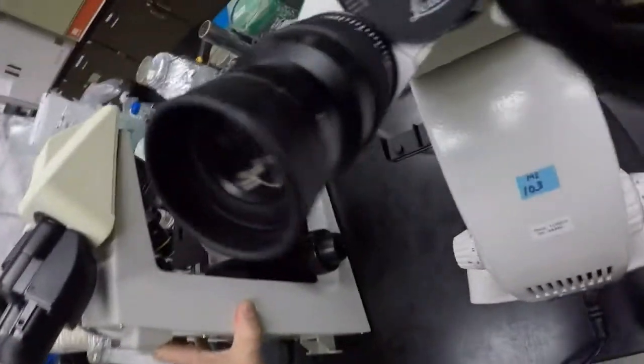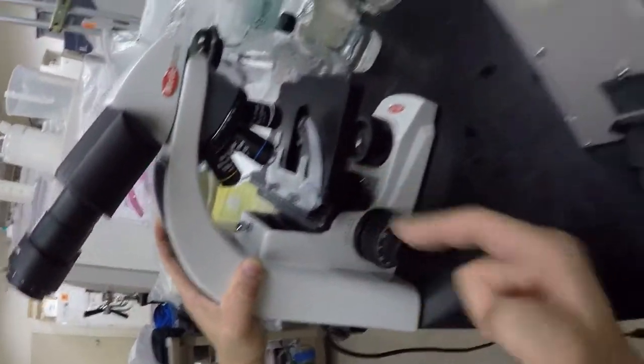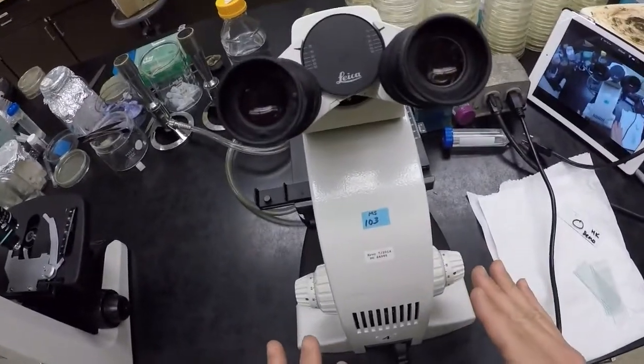These ones I just grabbed out of the cabinet, and look at these guys. That's the gigantic lens. That's not a good lens to have in there, right? Same over here. That's a 100 times lens, right? So, they're not always going to be left in the position that you want them to be in. So just get in that practice, or get in the habit of making sure that we have the safe lens in.